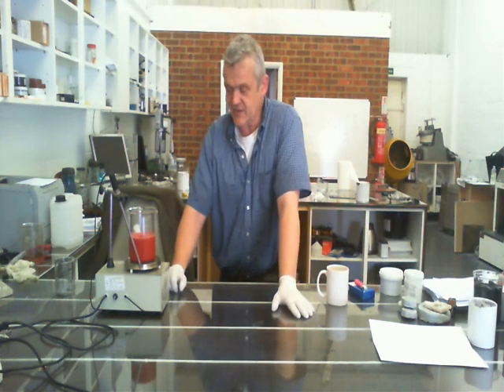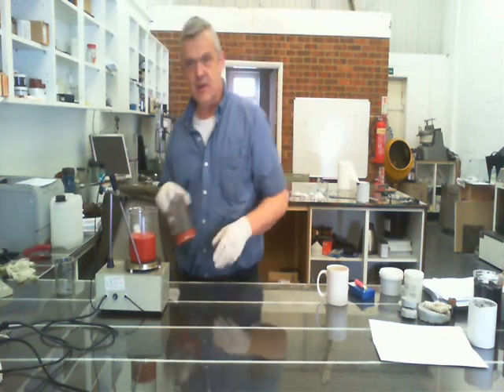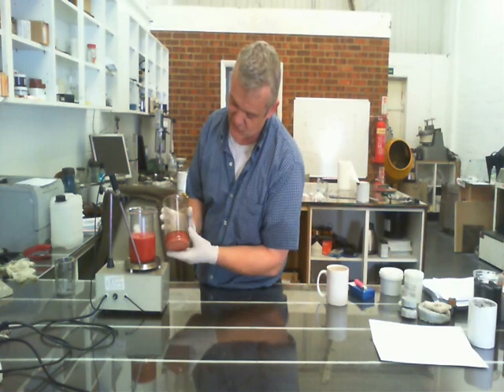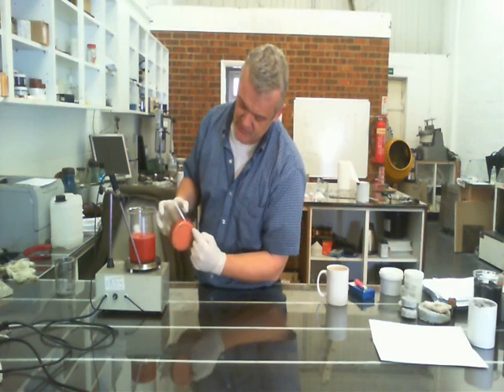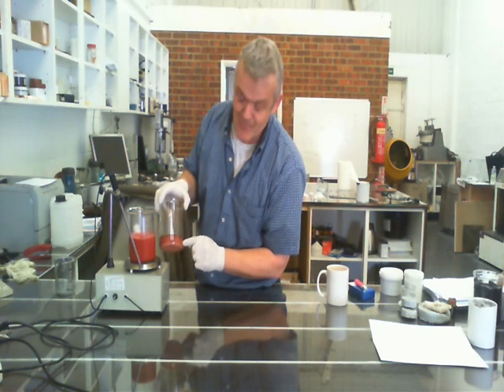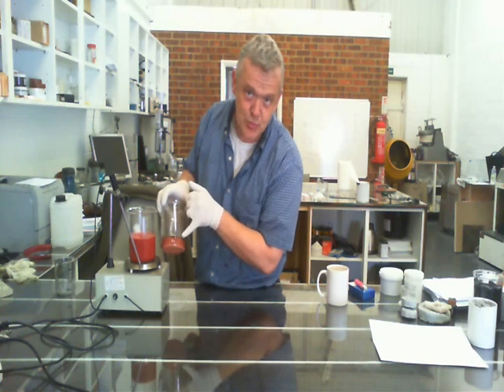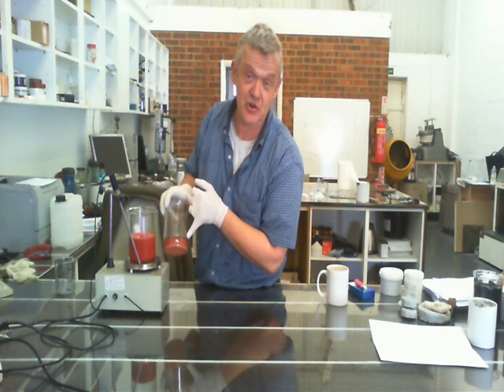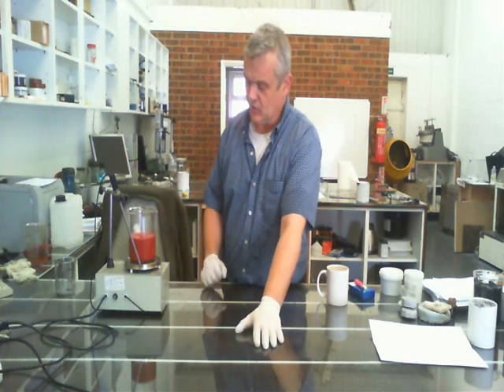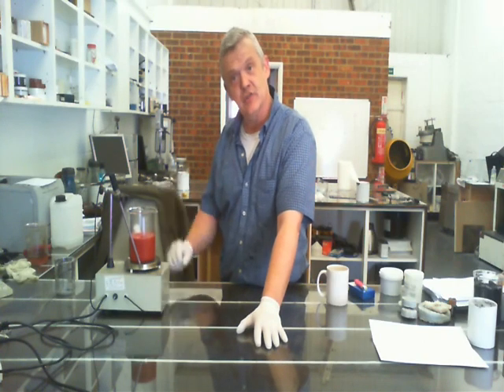Then just leave it alone. Over the next few hours it will change colour — going from brick red through orange to yellow to a kind of brownish colour. Here's what I did earlier for a colour comparison: you can see how brick red the fresh mixture is and how brownish pink the processed one is. The very pink layer at the bottom is quite large copper particles coated in gelatin; the brownish middle layer is much lighter copper particles; and right at the top the blackish-brown layer is copper nanoparticles coated in gelatin. This will stir for about six hours until it goes to that pink colour.